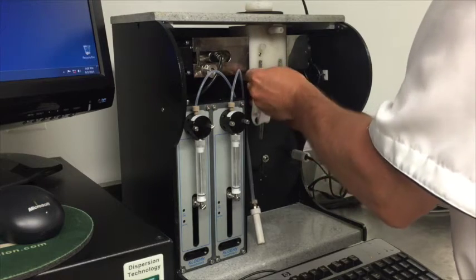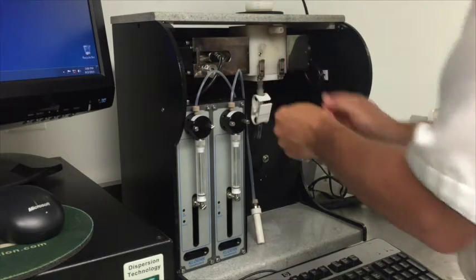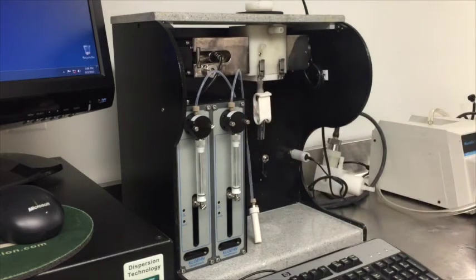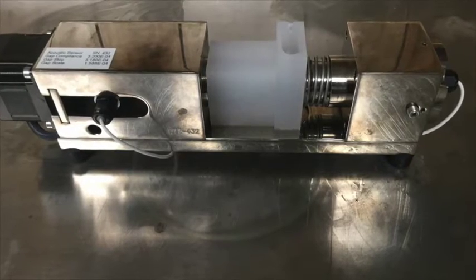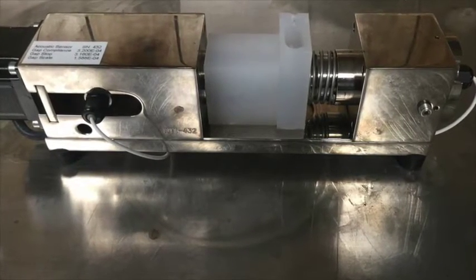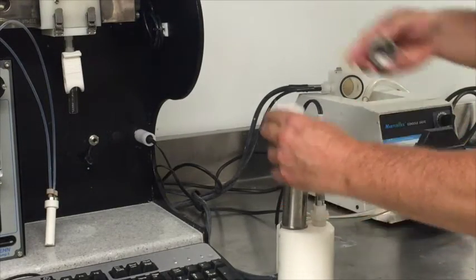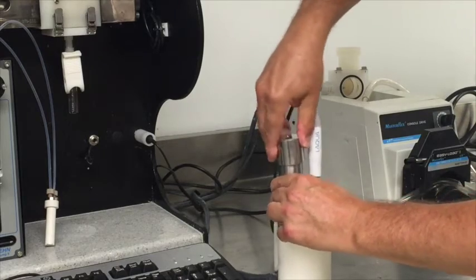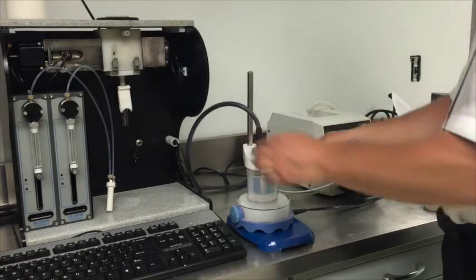Minimization of the sample volume for acoustic particle sizing is achieved by using this insert, which makes sample volume around 15 milliliters. Alternatively, we can use the acoustic sensor as a standalone sensor with an even smaller sample volume, around 3 milliliters. Minimizing sample volume for the zeta potential probe can be achieved using these cups, which are placed on the face of the probe. Minimum sample volume is 0.1 milliliters in the case with the steel cup. The zeta potential probe can also be inserted into the sample in an external vessel, which can be stirred or not.